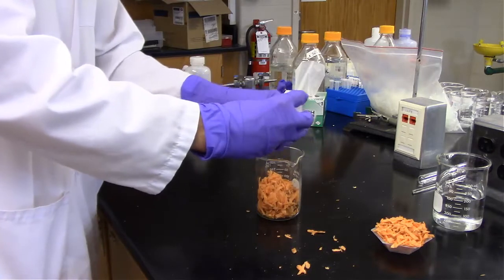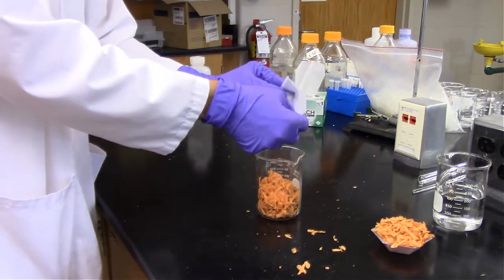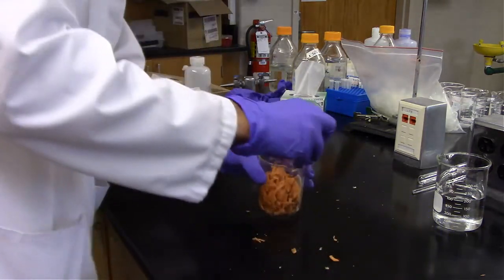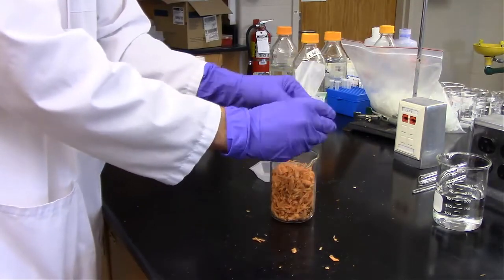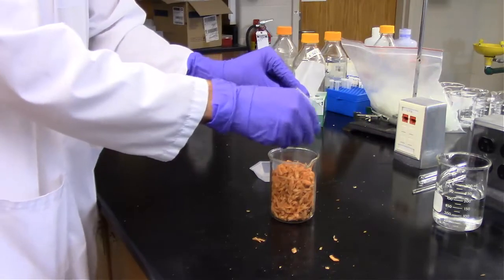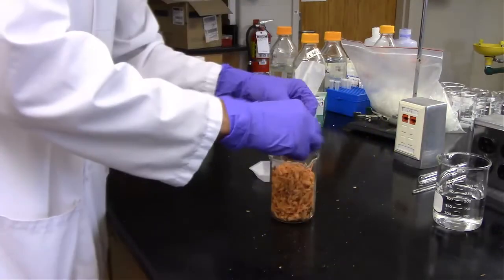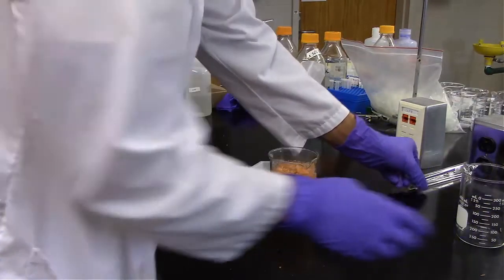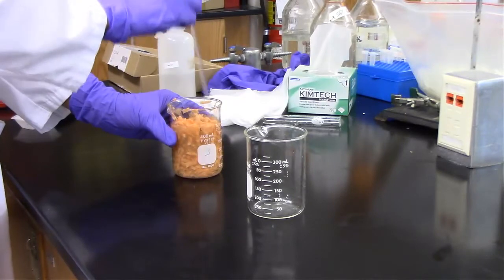As we continue, we're combining the extractions into one beaker. Looking back again, I probably should have used like a laminate mat underneath so I could just filter it all in there. That's 117 grams of sweet potato. And now we're adding some water in there. It's important to think about this.